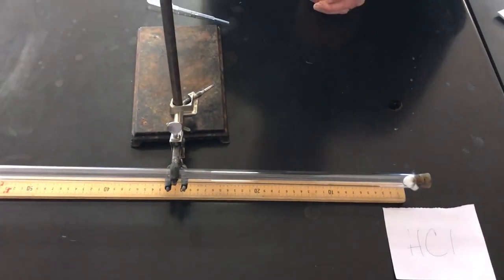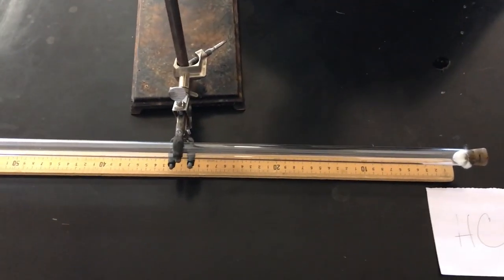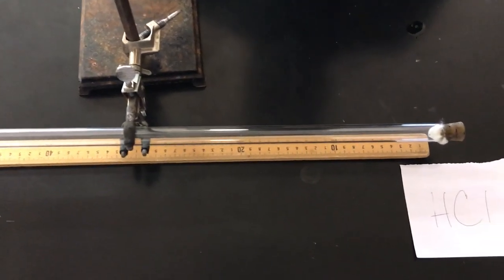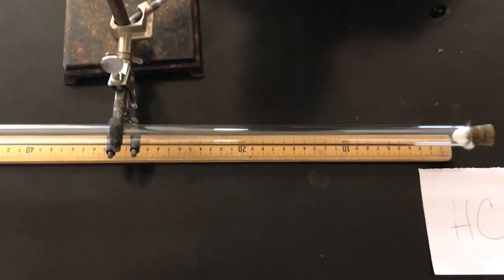Where are you looking Mr. Hevel? It looks like you're looking over closer to the HCl side. I am. Is that correct Mr. Moore? Am I looking in the right place? Well let's see. The HCl is a heavier molecule. The lighter ones move faster.